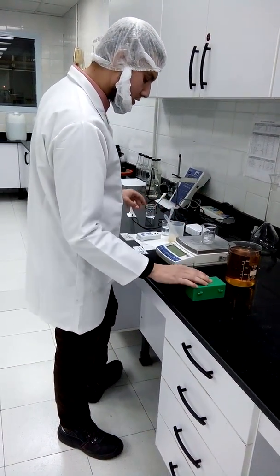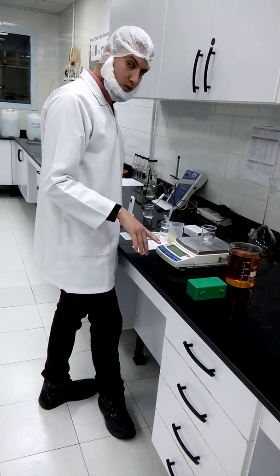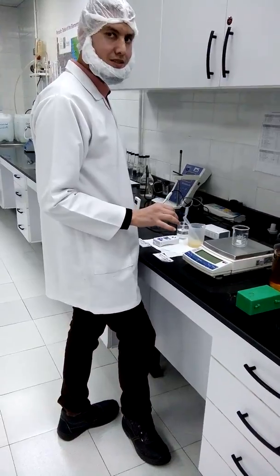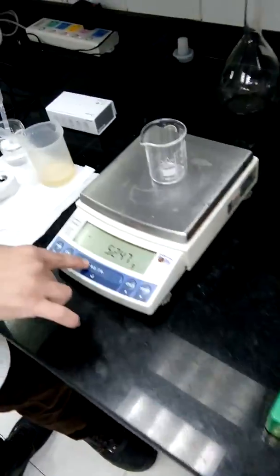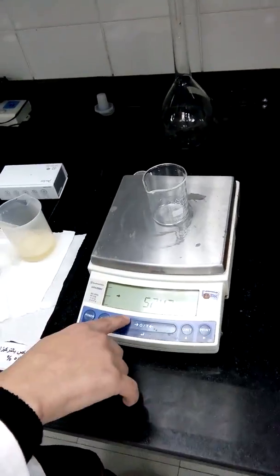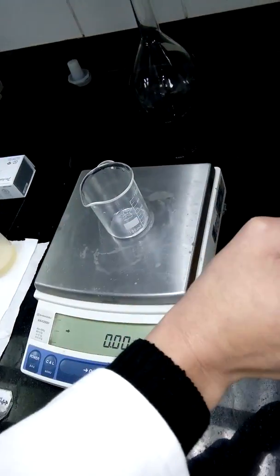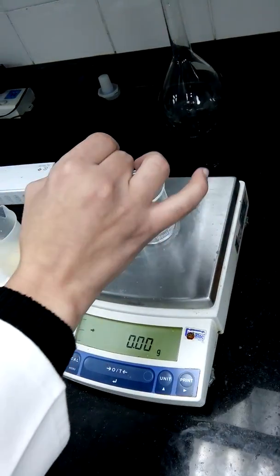With normal weight, I have to press zero to make sure our weight will be just for the sample. I have to put a good amount of sample.